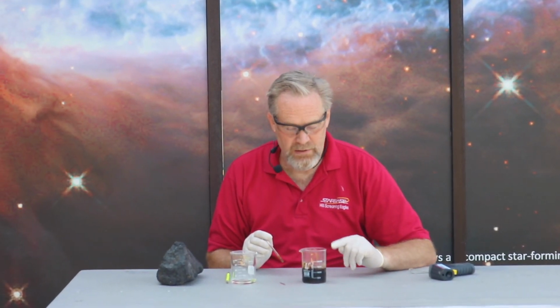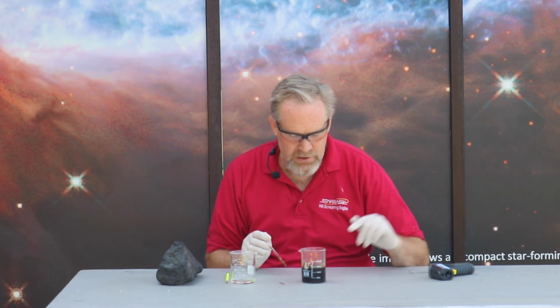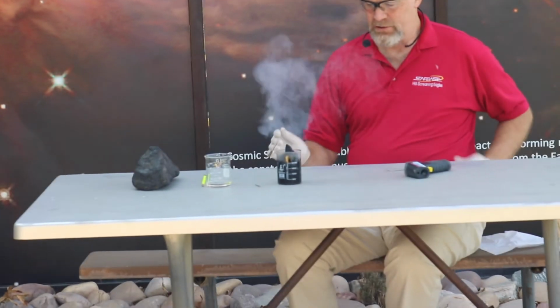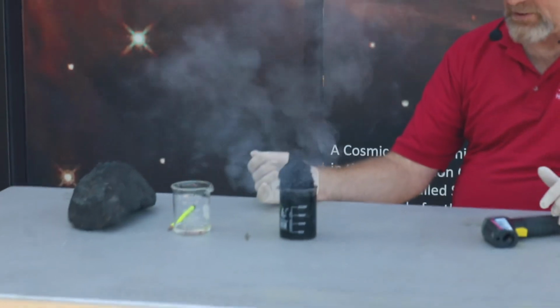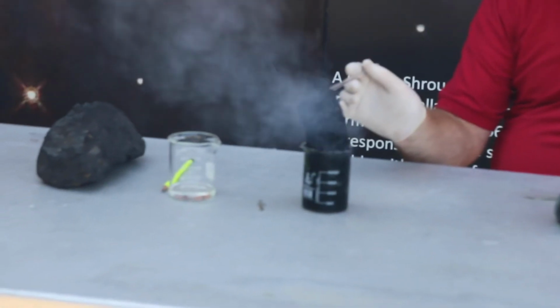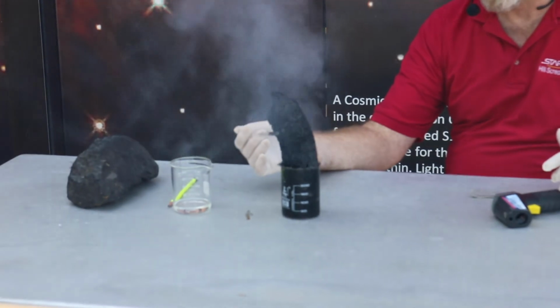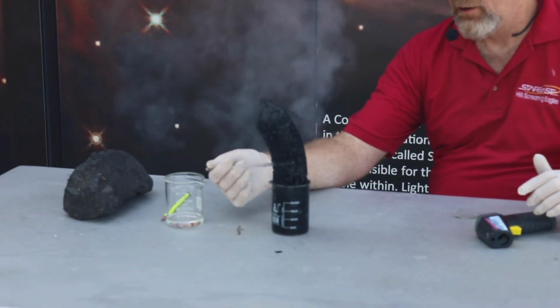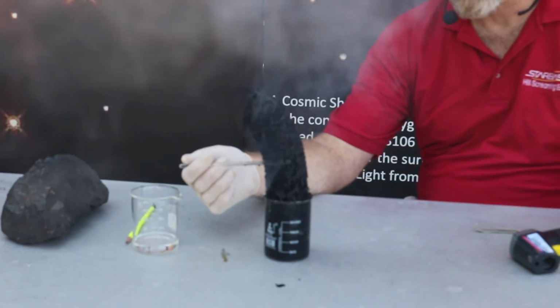You can see that starting to change in volume. It's starting to get larger, increasing, moving up. It's now bubbling. Got sulfuric acid bubbling at the top of it. And I got some water vapors coming out. This is getting very, very tall. And this is now kind of like charcoal, kind of like coal. This is now just carbon, pure carbon from that sugar, from white to black.